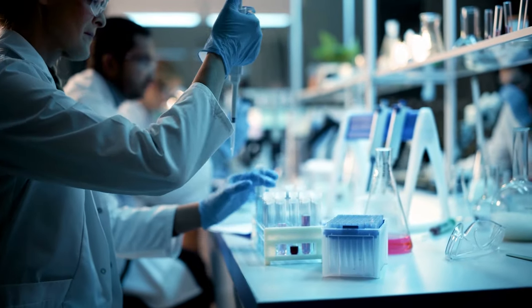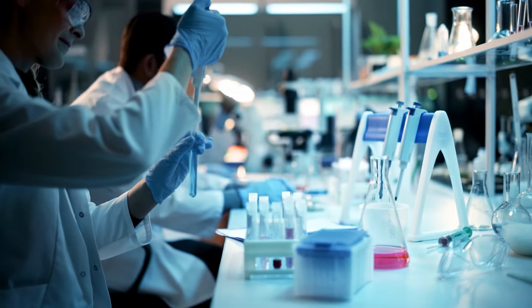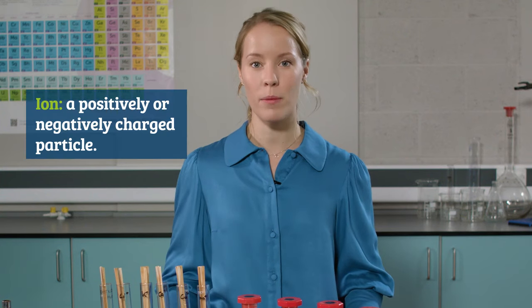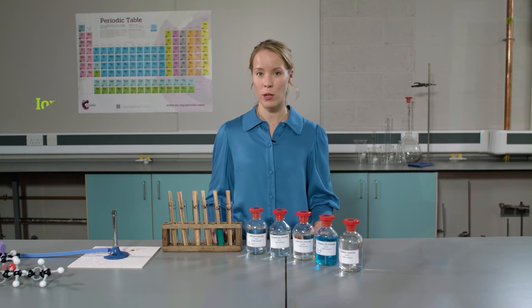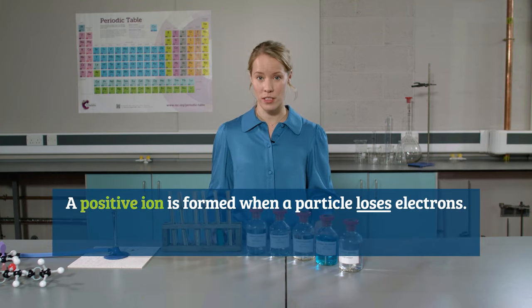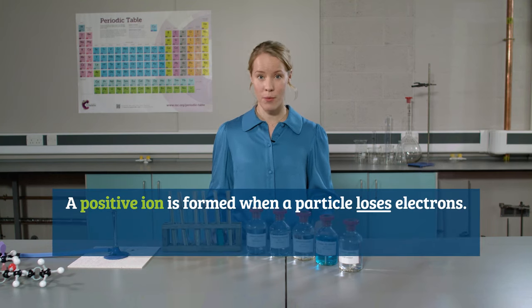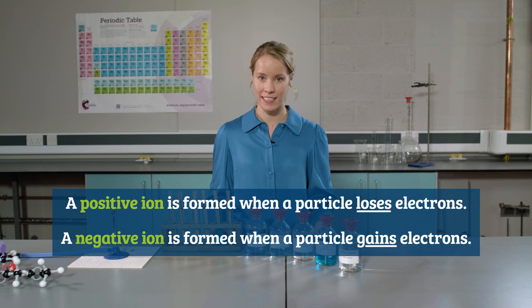Production chemists may also carry out random chemical tests as part of the quality control process when manufacturing substances. I'm going to carry out three short experiments that can be used to identify ions. When an atom or molecule loses negatively charged electrons, the ion is positive. When an atom or molecule gains negatively charged electrons, the ion is negative. Once you know these tests, you will have a toolkit to help you identify an unknown substance in a laboratory.